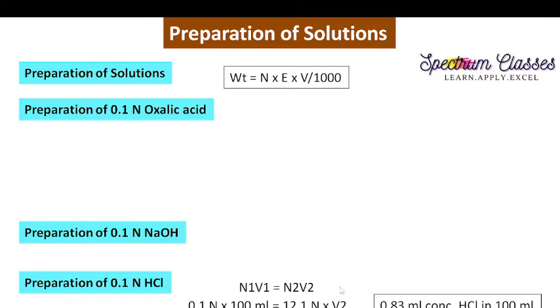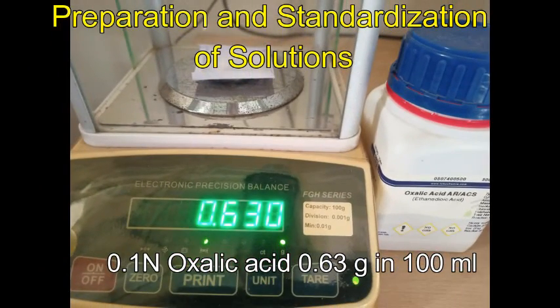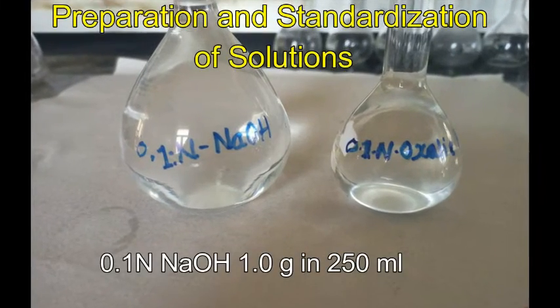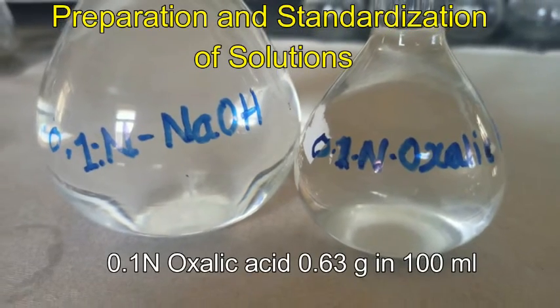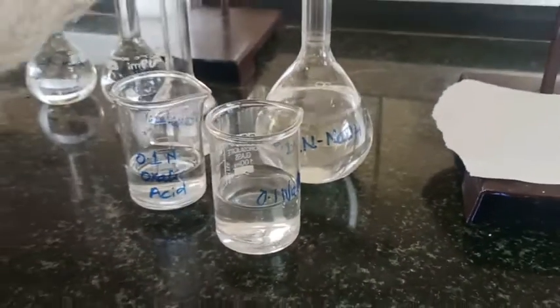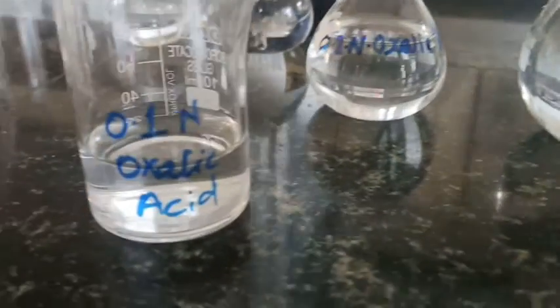Now we are going to see the lab activity. I'm just going to prepare the oxalic acid 0.1 normal and NaOH 0.1 normal. For preparing this NaOH, I have taken 1 gram of NaOH in 250 ml and 0.63 gram of oxalic acid in 100 ml. So these are the solutions which I have prepared. This is 0.1 normal. I have transferred them into beakers, right? This is just for convenience.